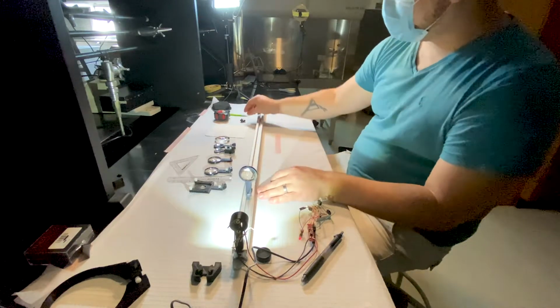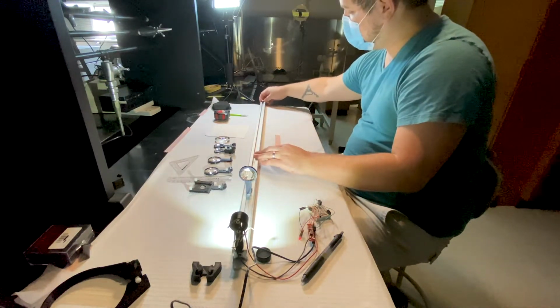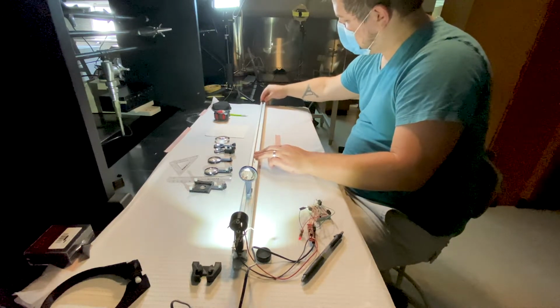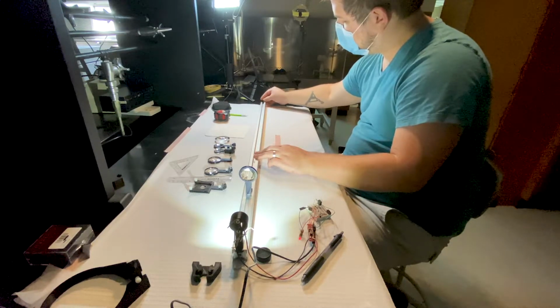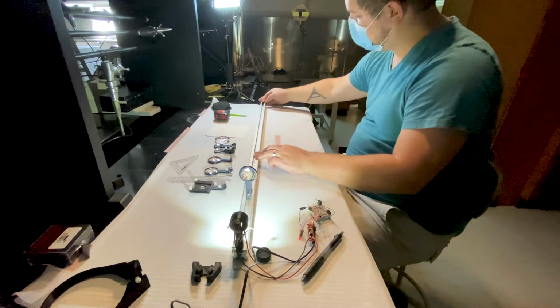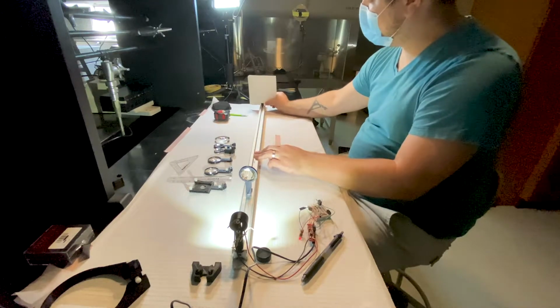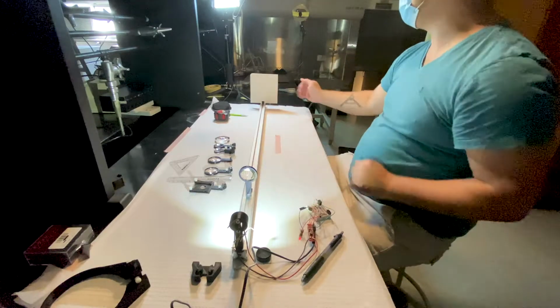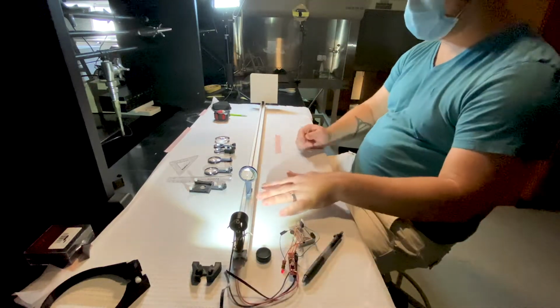Now, what I'll also show you is what the screen looks like. So I'm just going to be mounting a white piece of paper that I can slide back and forth just to show you what the light looks like at different places along this optical axis. So let's consider the far field, something a very far distance away from our light source and our lens, what that looks like.